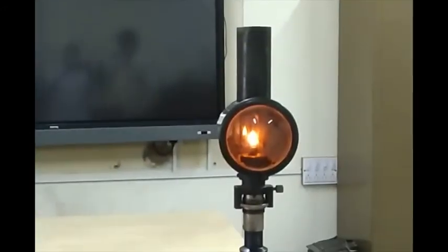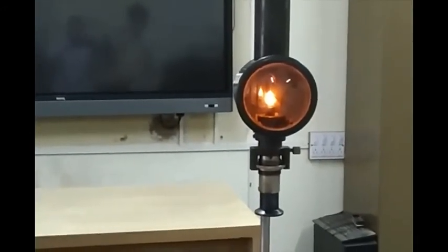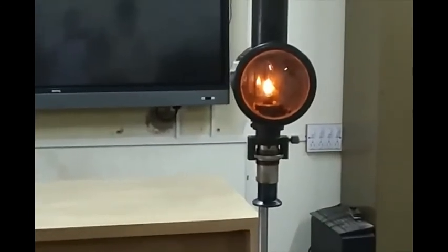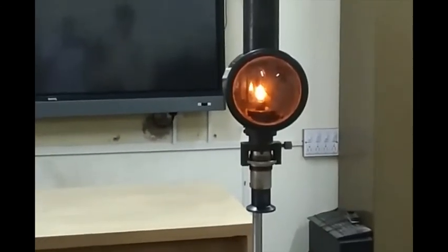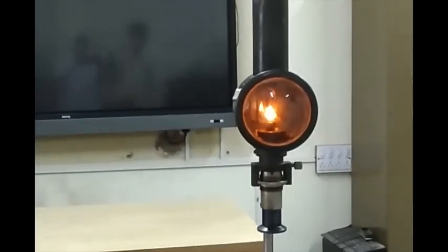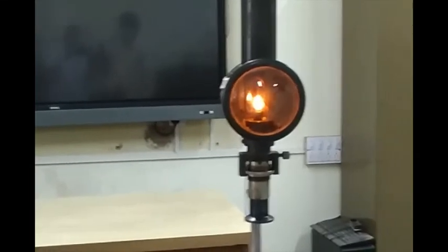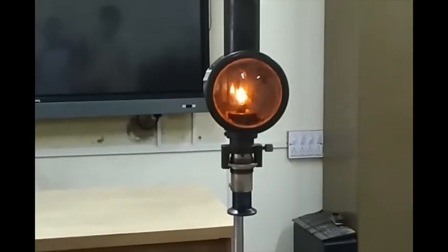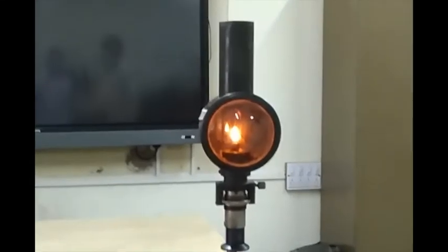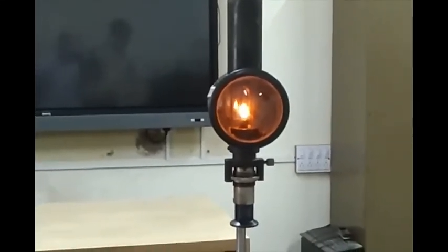That is how we read the smoke point. Depending on the components of the fuel, you will have different smoke points. If more aromatics are present, the flame will be smokier. We note down the reading as 22 mm and analyze what kind of fuel it is. This completes the experiment on smoke point of a petroleum fuel.